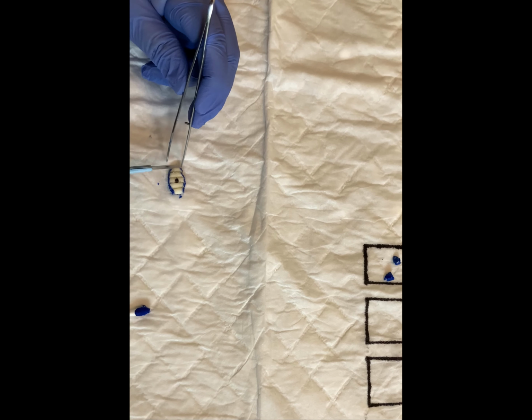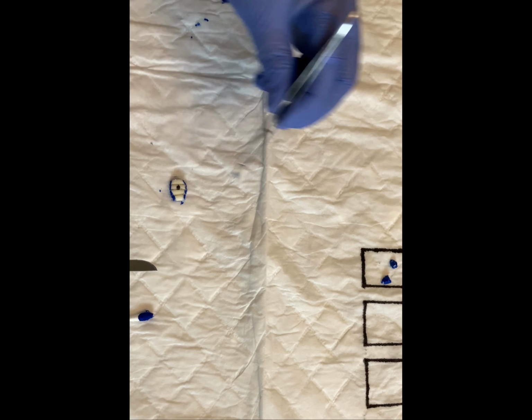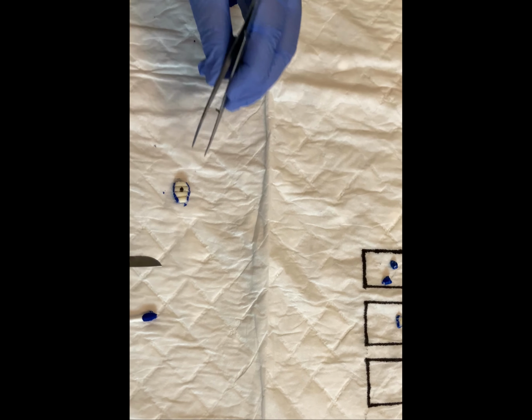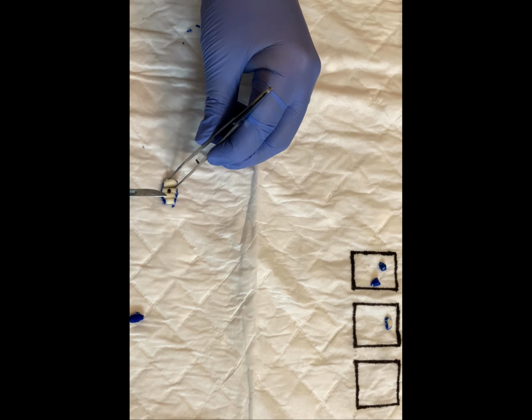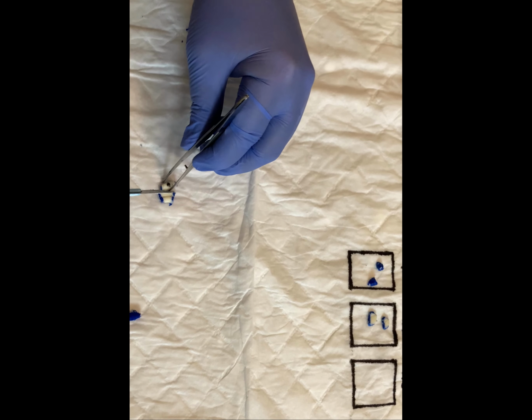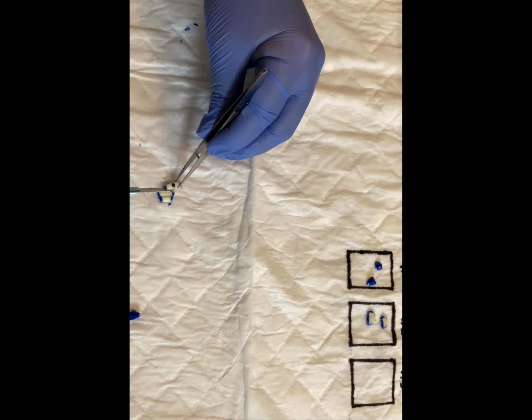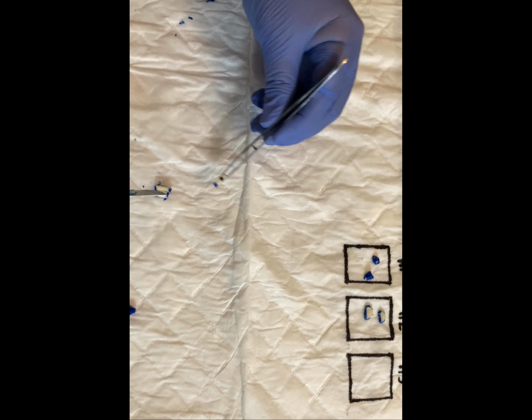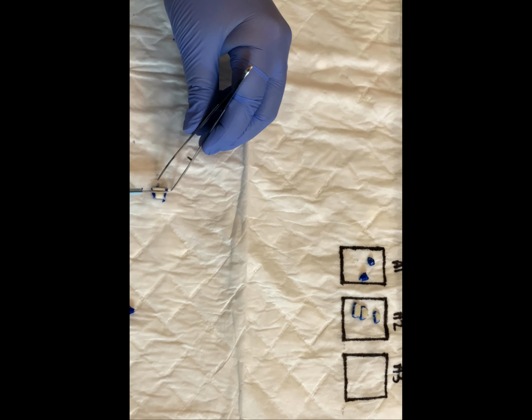The remainder of the specimen will be submitted entirely and in sequential order. Be sure not to submit over 3 sections per cassette, as this too can alter fixation and processing of the tissue. On a real specimen, remember to inspect all surfaces of your sections for any lesions or abnormalities. Be sure to measure the depth of invasion as well. This lesion only demonstrated superficial involvement.